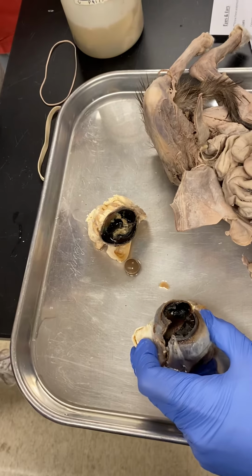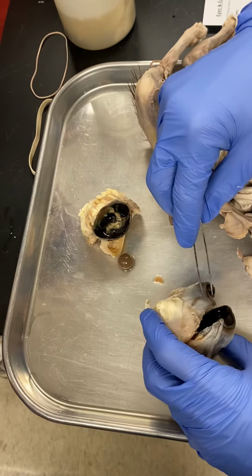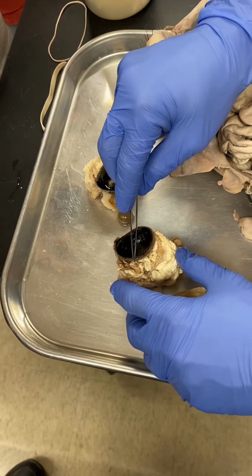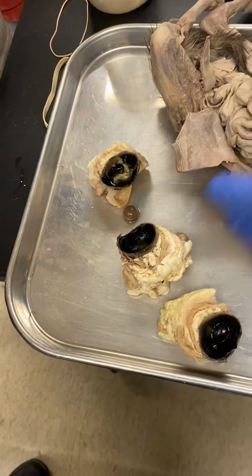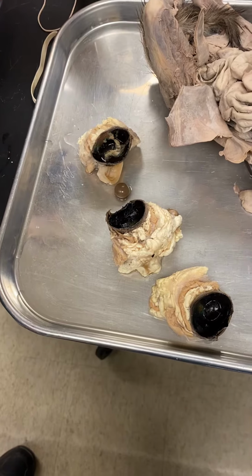The cornea. Okay, the cornea actually travels backwards into the sclera, and so cutting this in half, this would be the scleral layer here, and the function of the sclera is really just to keep the form of the eyeball, right? Keep it from collapsing in on itself.